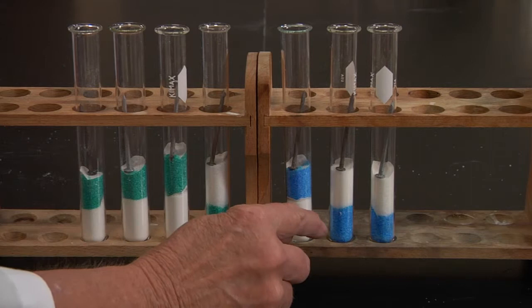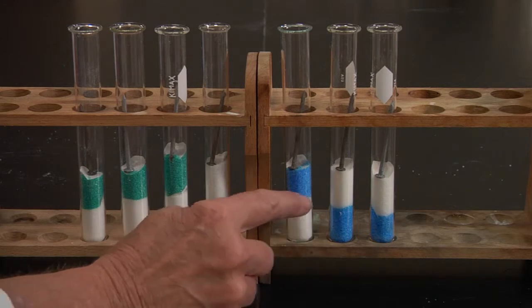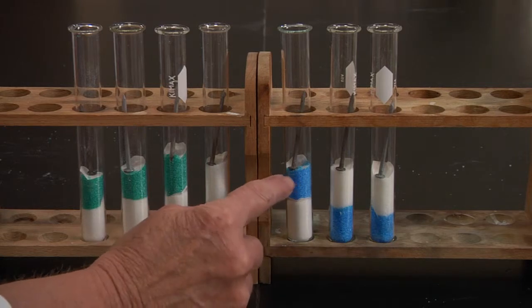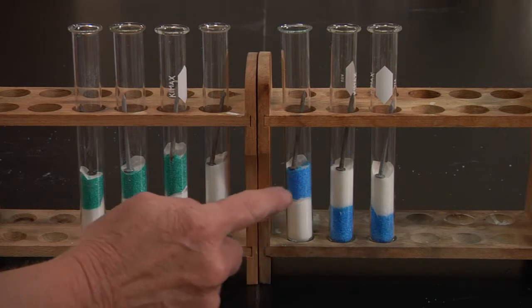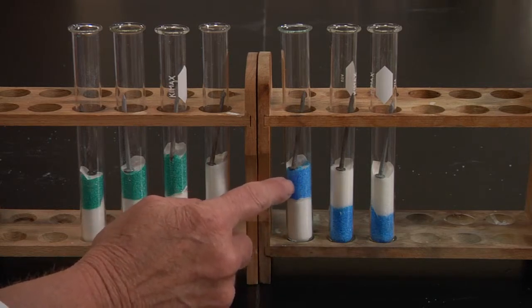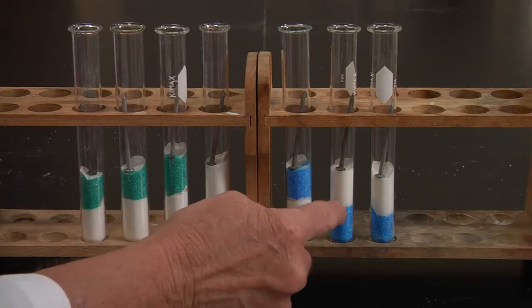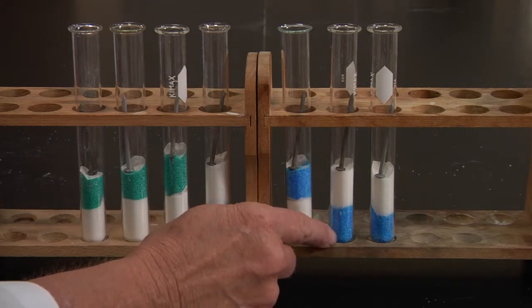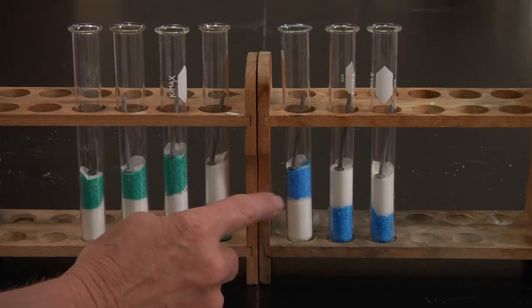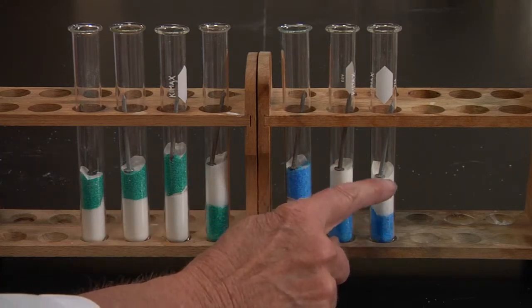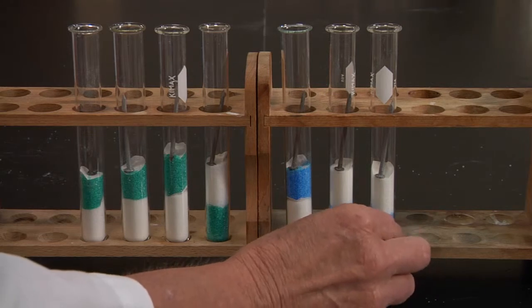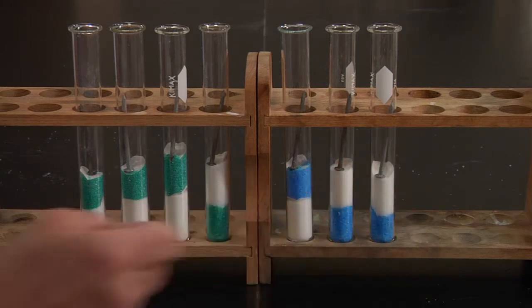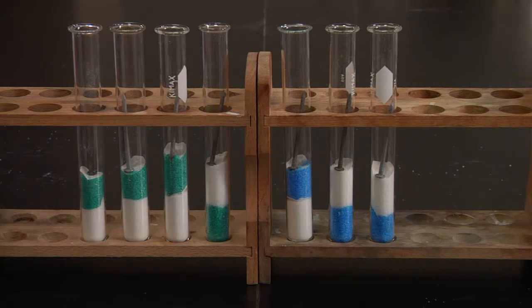Over on this side, we have substituted copper sulfate instead of the copper chloride. So we have copper sulfate and an iron nail, and then a galvanized nail. These two, the galvanized nail is different. These two, the order is different.